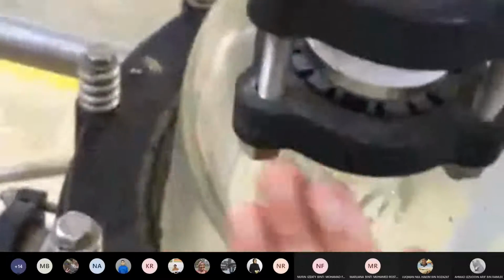So you see it goes in. Maybe you think this flows into the reactor. No, it flows into the outer vessel, so that the outer vessel will be filled up with water to heat up your reactor. So just imagine I have two layers of vessel. The inside is the reactor, the outer one is where you have the heating fluid or the cooling fluid. Okay, so that's one thing.